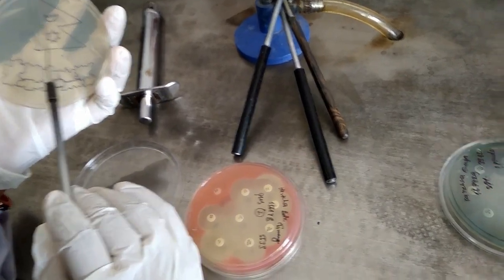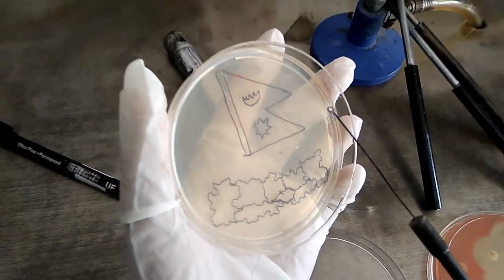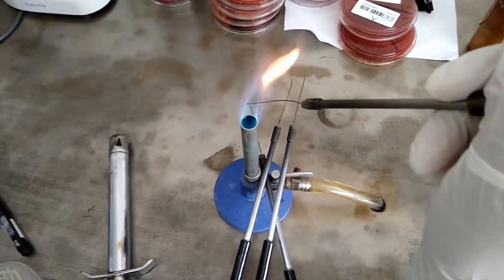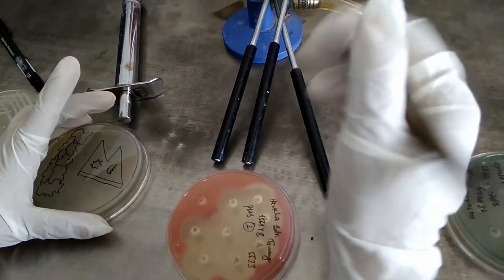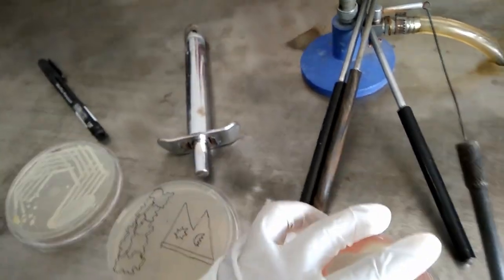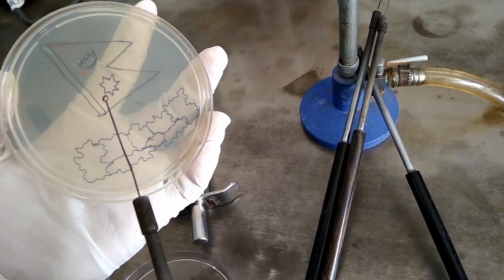Make a rough sketch of your choice as shown here. Fill the borders or spaces with these living microbes according to your color choice. When changing the organism, please sterilize the inoculating loop or wire. Incubate the agar plate at 37 degrees Celsius overnight.